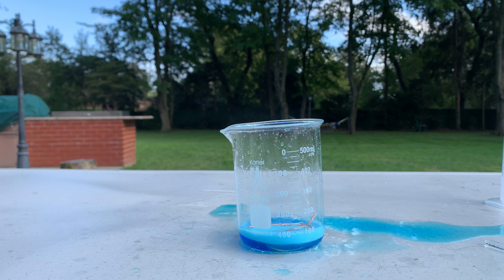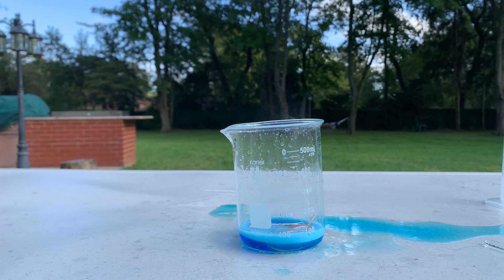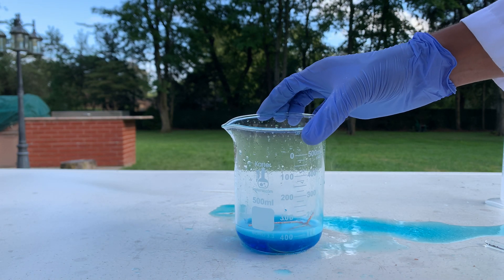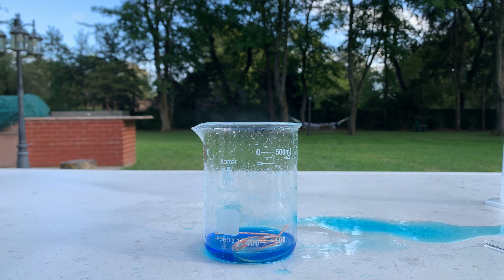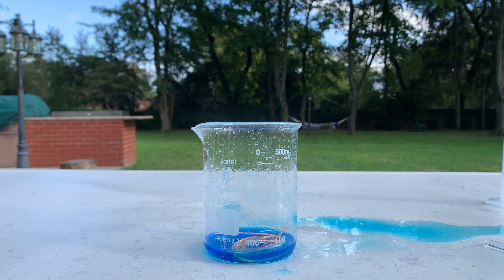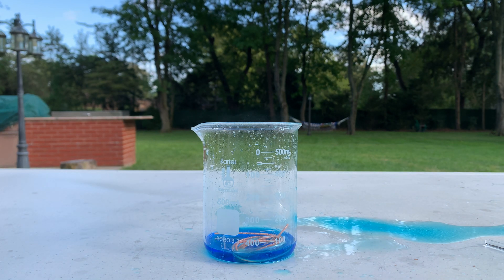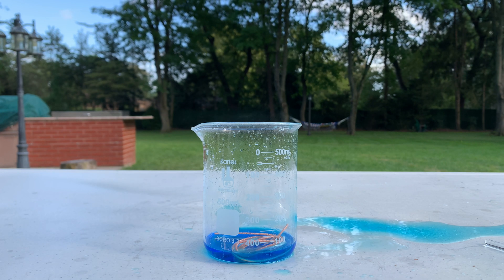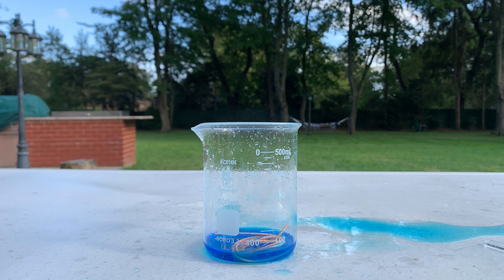Look at that solution — wow, it's a nice dark blue, very concentrated copper sulfate. Since we lost a decent amount of the solution, I think I'm just going to add 20 more milliliters of hydrogen peroxide and about five more milliliters of sulfuric acid. I want to let this solution sit for a bit and get a decent amount of copper sulfate because I have a lot of stuff planned — I want to make a lot of copper complexes.